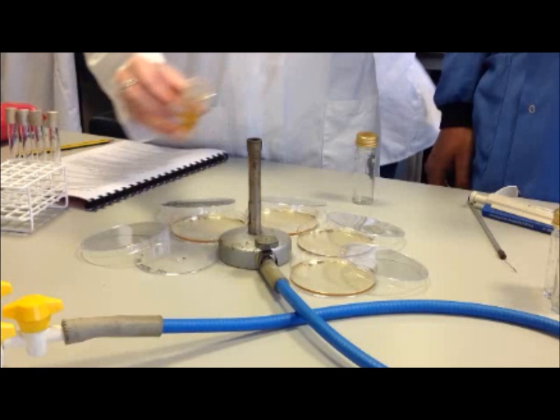And then you plated 100 microliters from each of your dilutions on an agar plate. This week you're going to count how many colonies you can see in each of those agar plates.